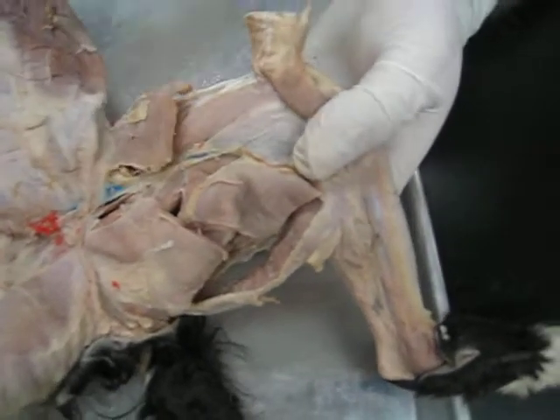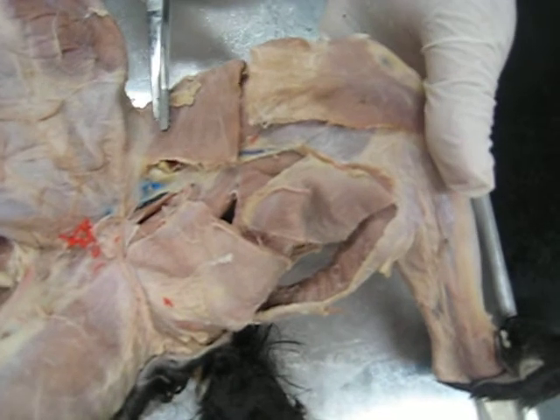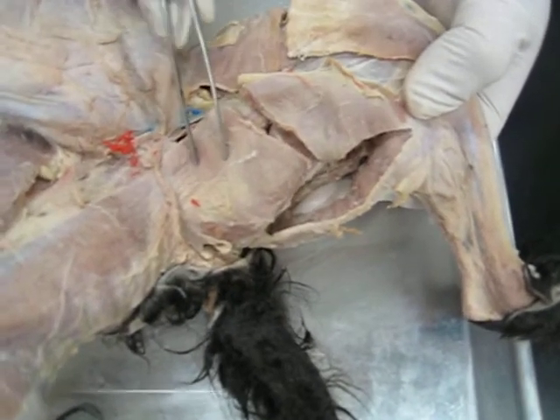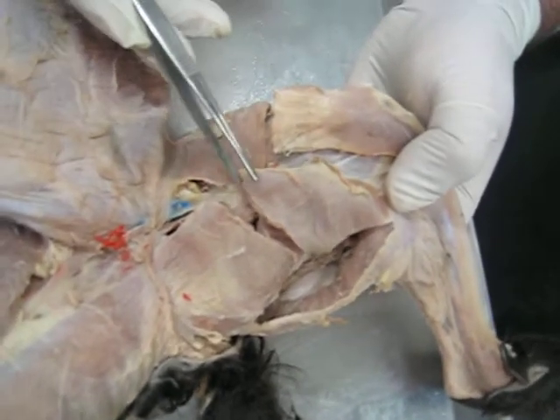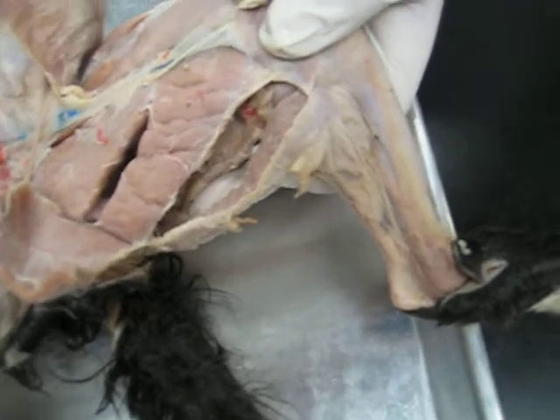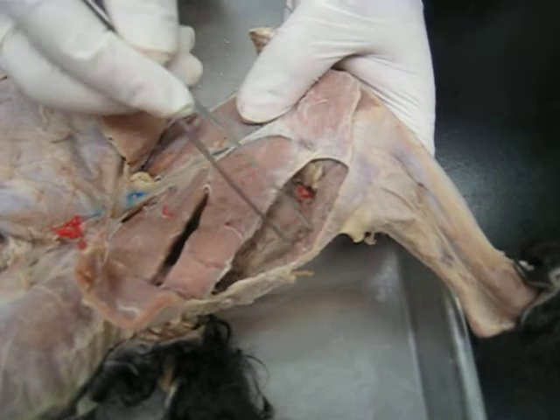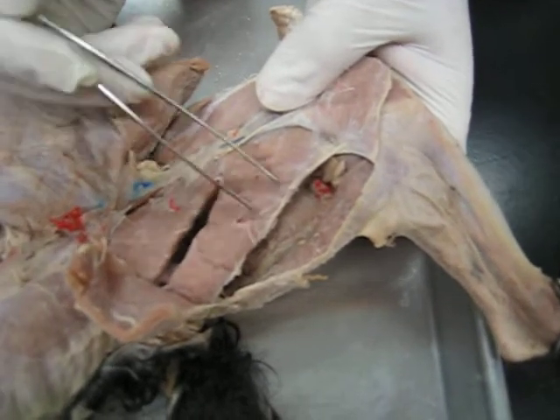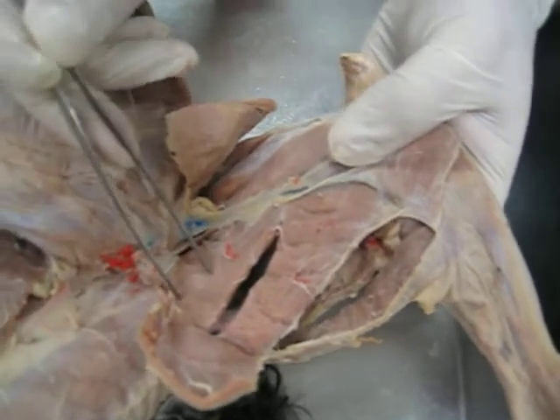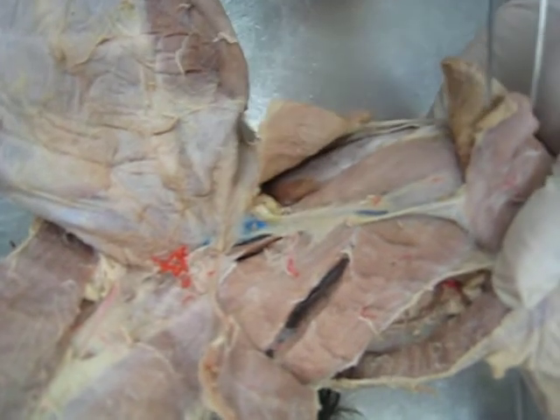So if I put these two back again like this, this is sartorius, and this is gracilis. So if I open and expose, from this region I have the semitendinosis, semimembranosis, I have the adductor femoris, the adductor femoris, and this little guy here is adductor longus.